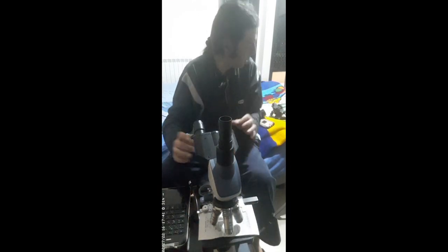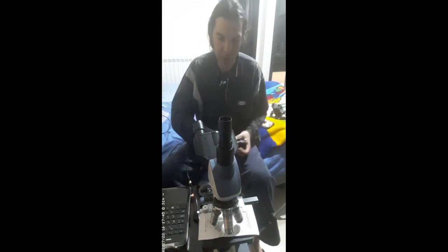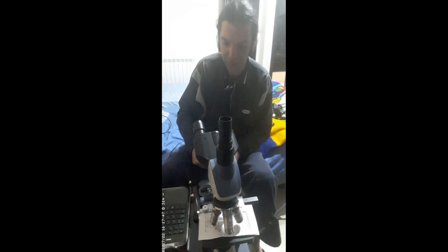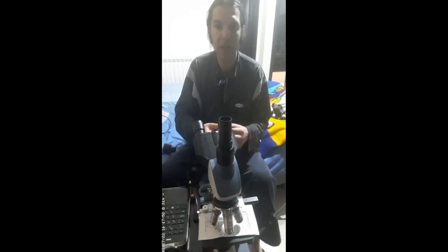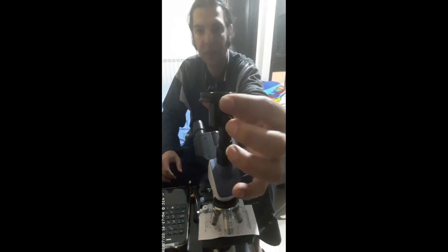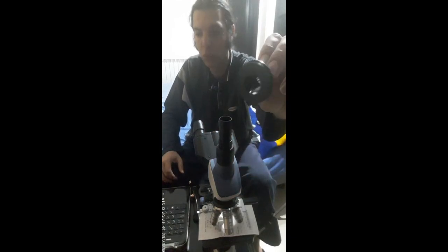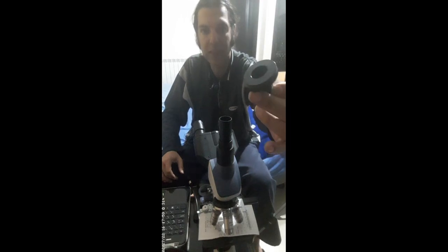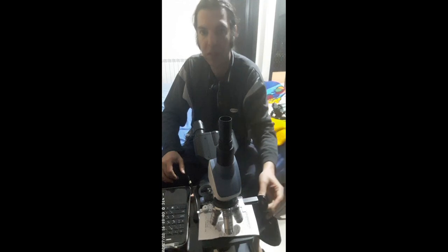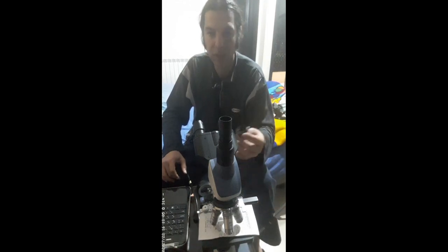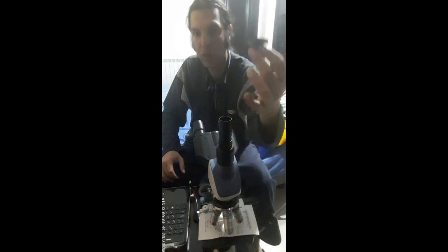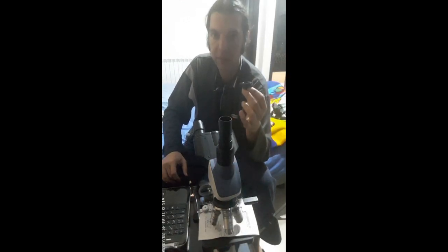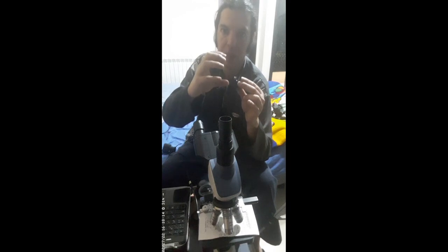First of all, this is what I have in my hand. This is what you should be doing. First you have to get this T2 adapter. It's very important that you have to memorize these names if you have interest in photography using telescopes and microscopes. I have to use this T2 adapter which is used by DSLR cameras to hold the camera.